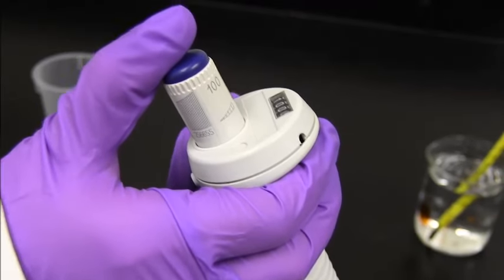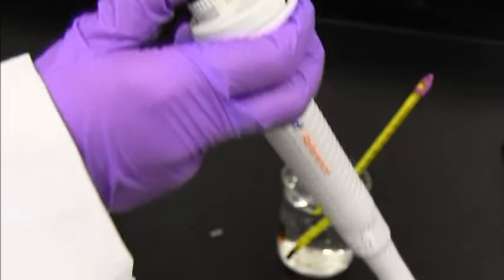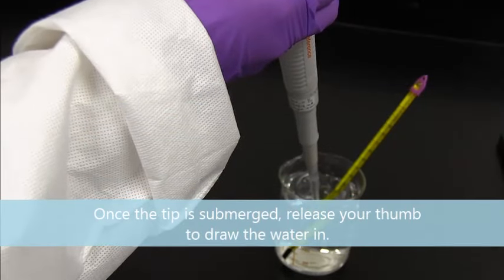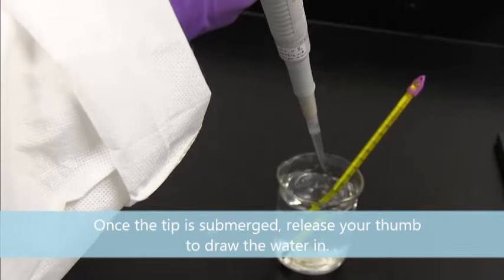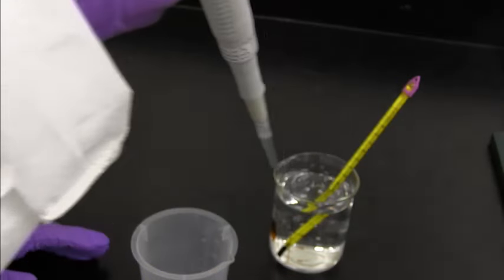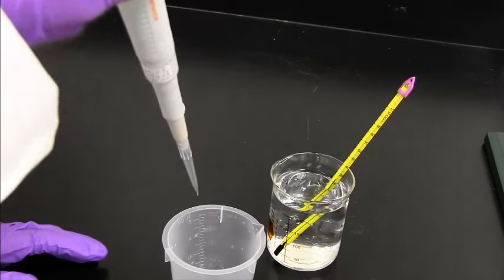So to be able to get our water sample, we're going to go down to the first stop, put our pipette in here, and take some volume. So that was the first stop in order to get the volume. In order to dispense your volume, you're going to go down to the second stop. You can hear a little click.